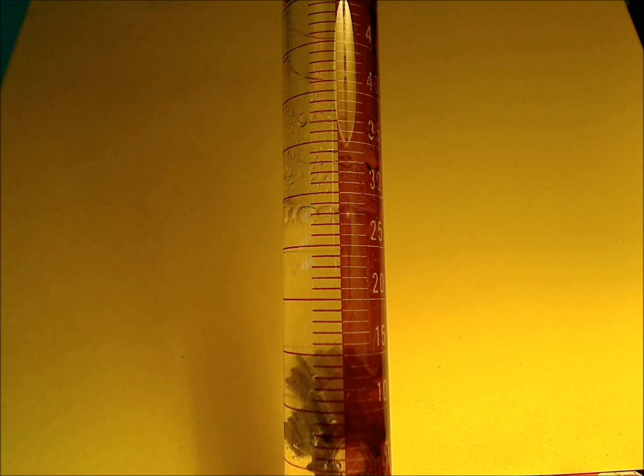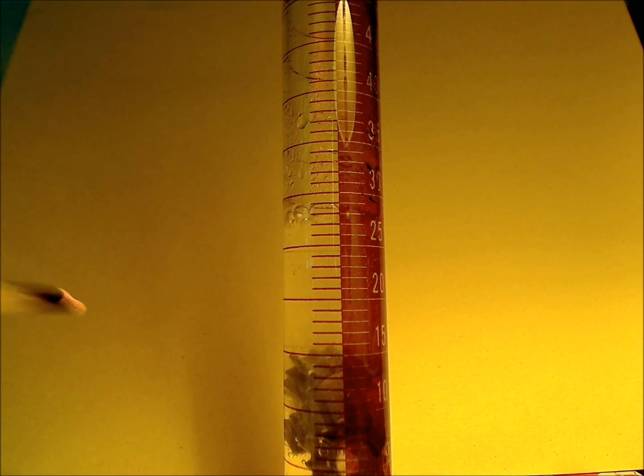I don't even have to put it in very far. It pops, makes a neat popping sound, which students seem to enjoy.